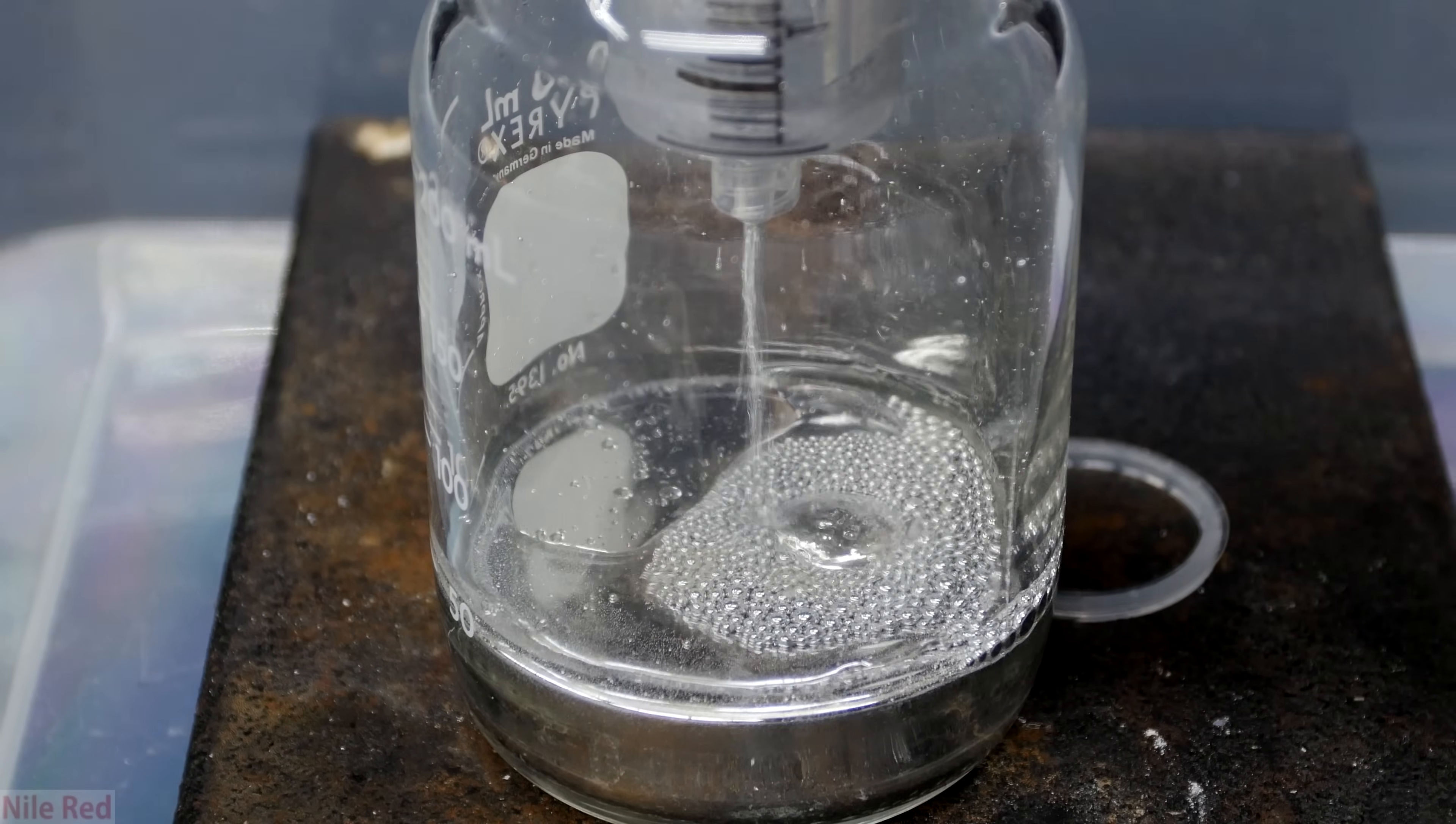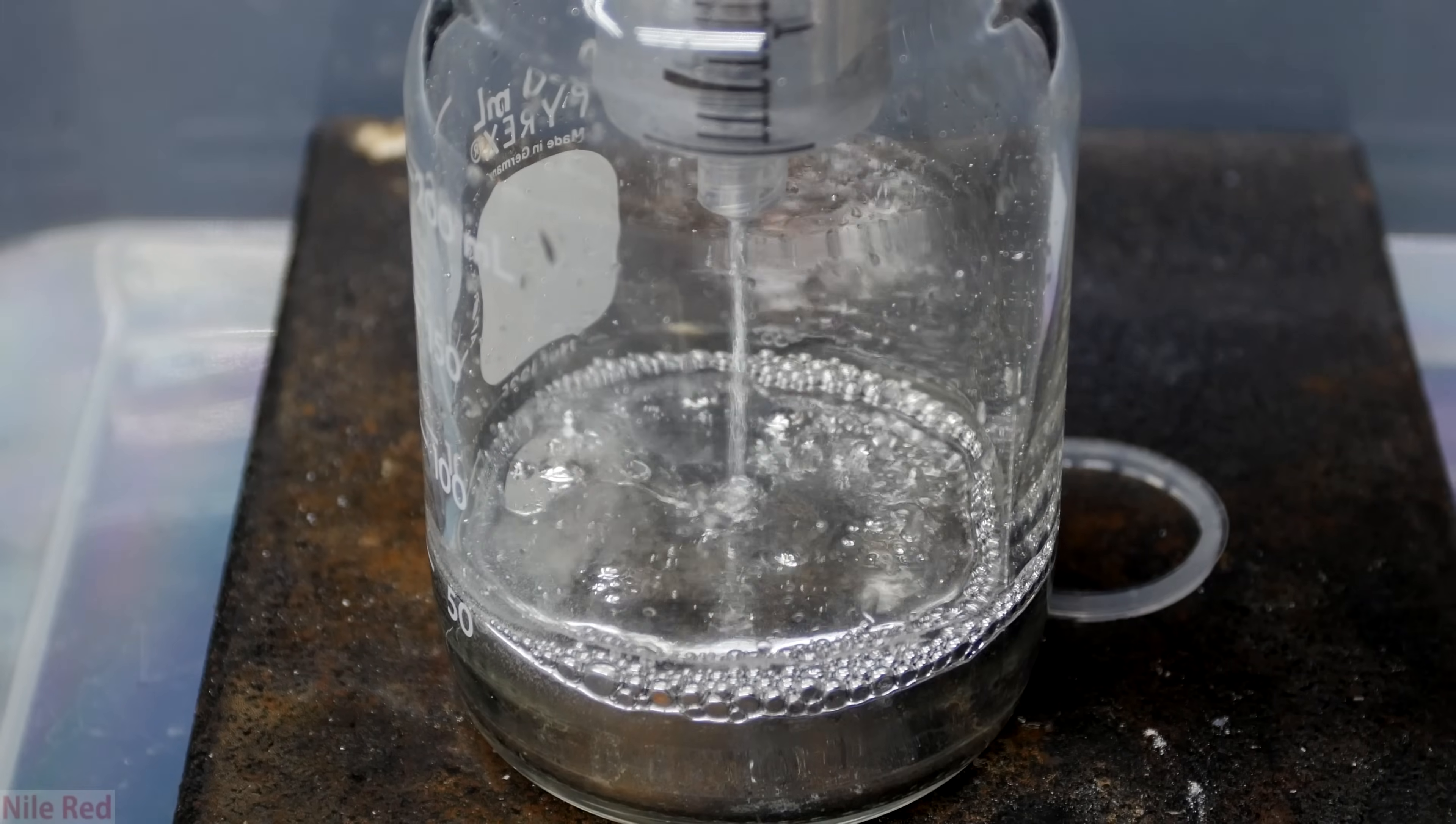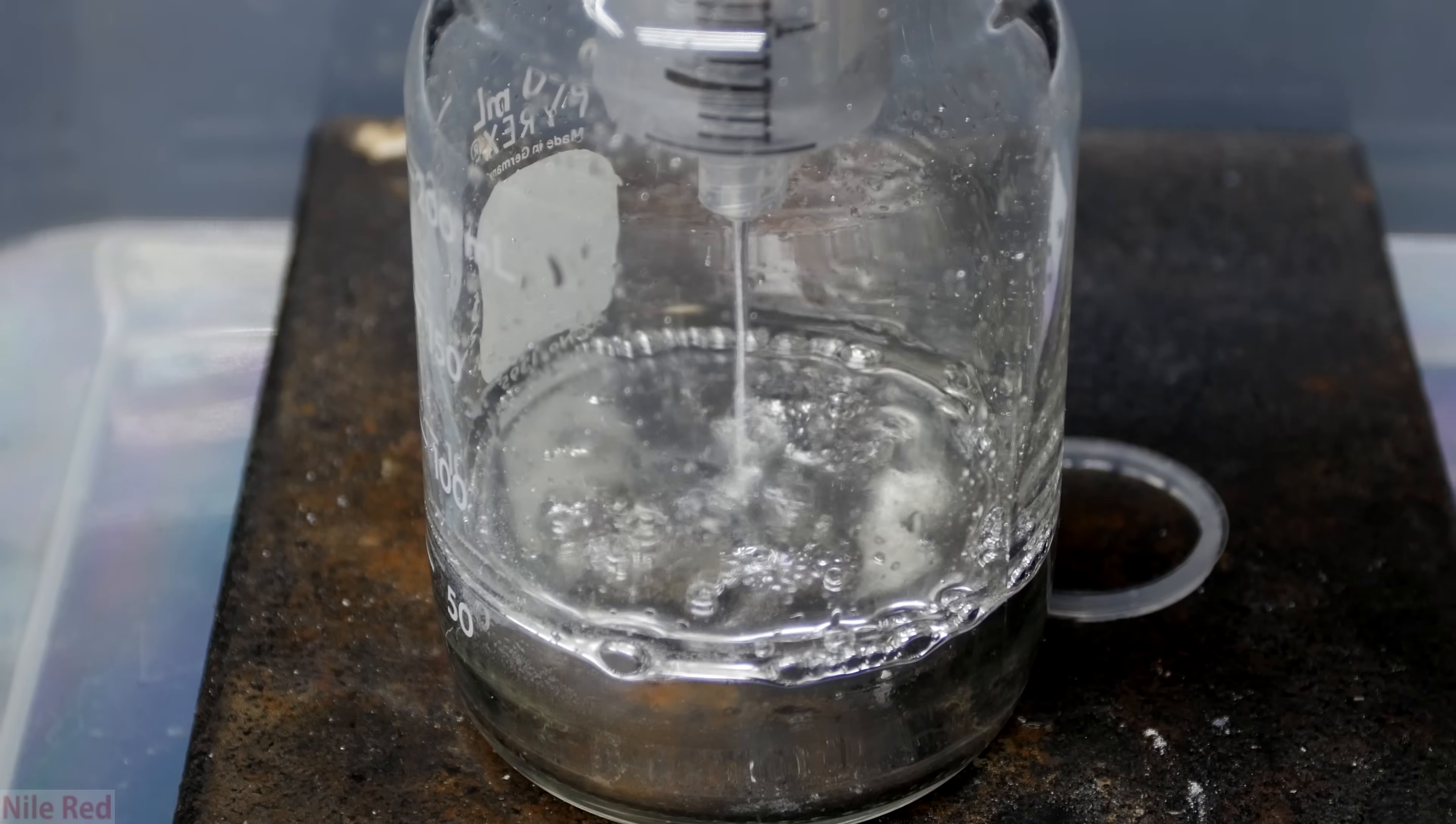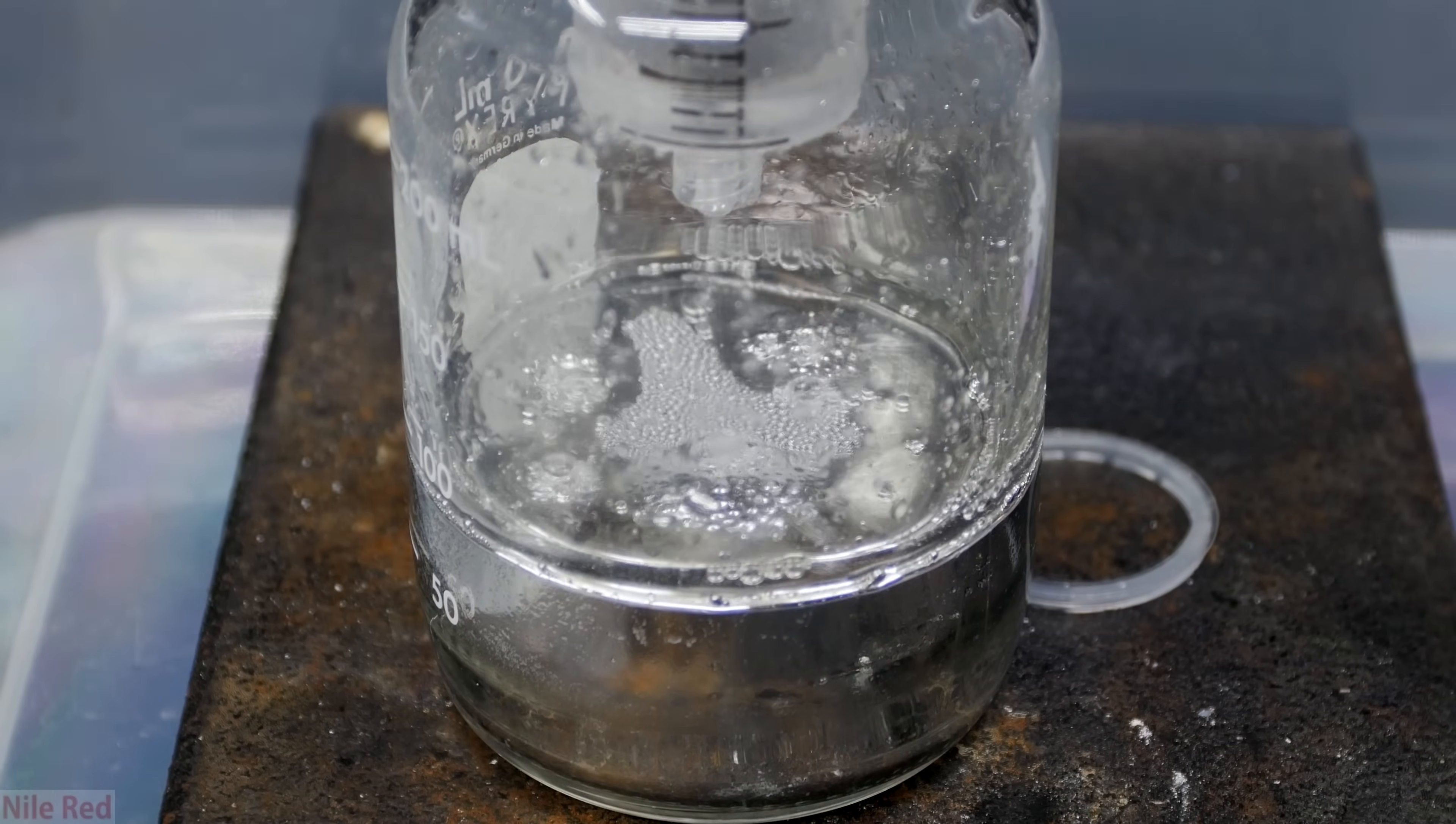So the filtering step was successful but you can still see that there's oil there. If you're really just looking to get rid of the oxide scum or dirt, broken glass, etc., you can stop here. The filtering process is enough. In other words, if you're looking for just aesthetics, filtering it through the cotton will make it look extremely clean and shiny. Because I want to remove the oil and get rid of some of the soluble impurities, I proceed on to some washing steps.